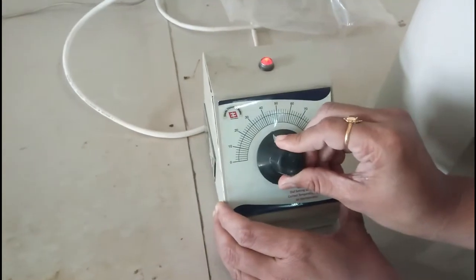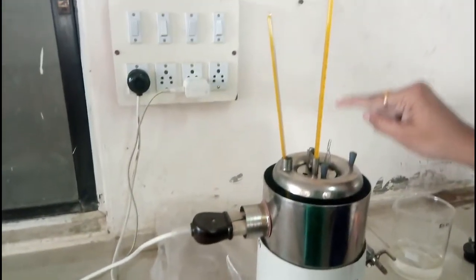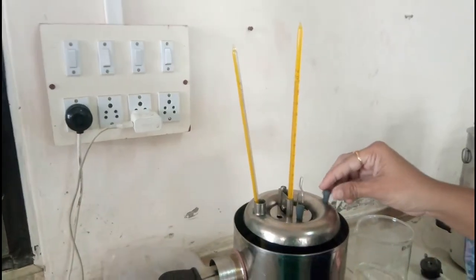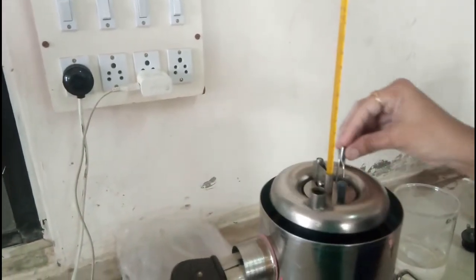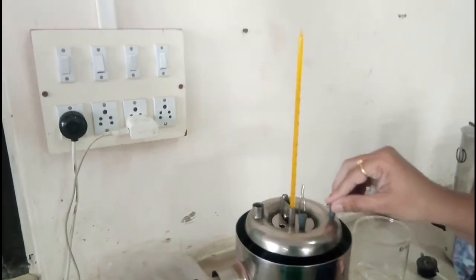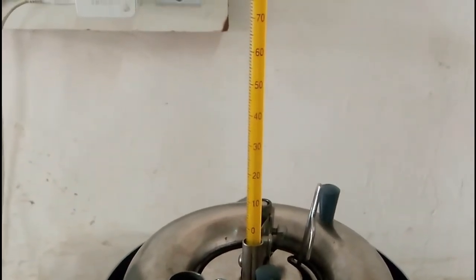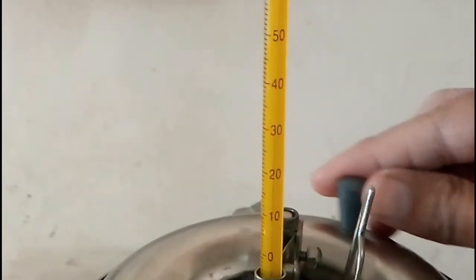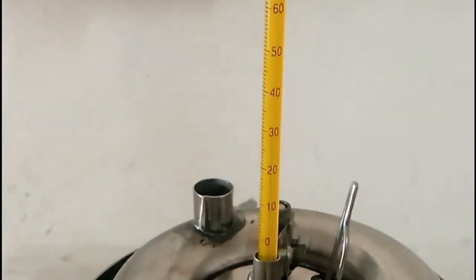I will increase the temperature. I am going to place the thermometer on the top — it will show the temperature within. The temperature is increasing — 30 degrees. There is a fine hair-like line up to 30. Yes, 30 degrees. You can see the temperature is increasing.